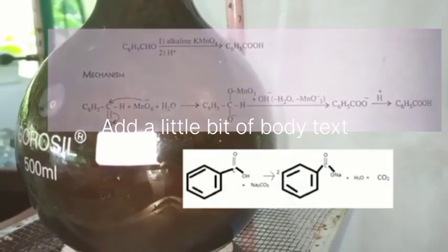The benzaldehyde is oxidized to form carboxylic acid. Here potassium permanganate gets reduced to form manganese dioxide, which is that brown colored suspension. Keep adding the potassium permanganate solution.